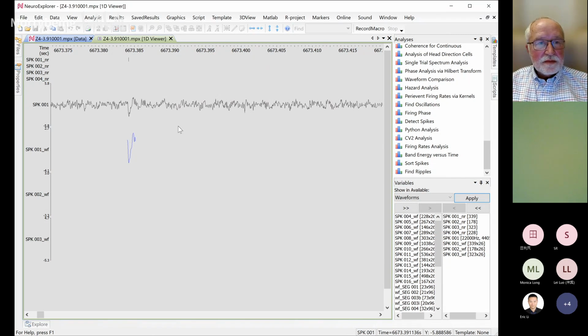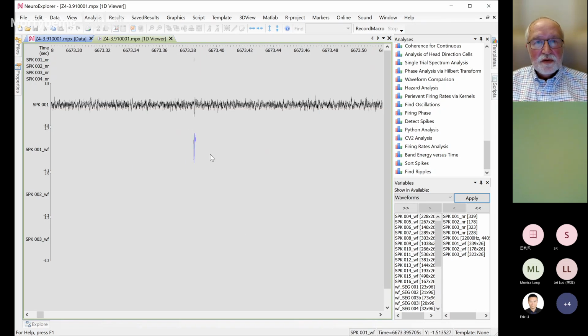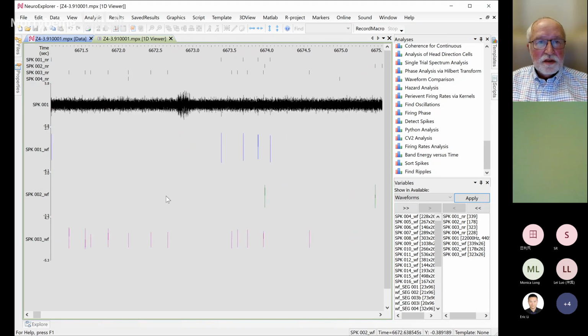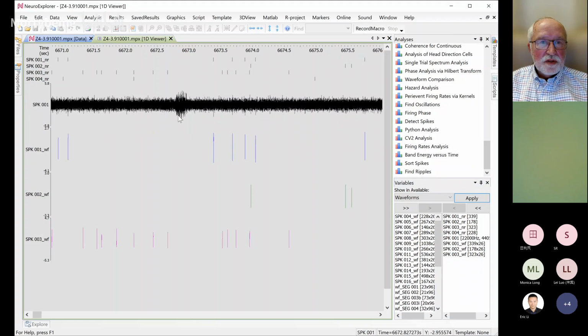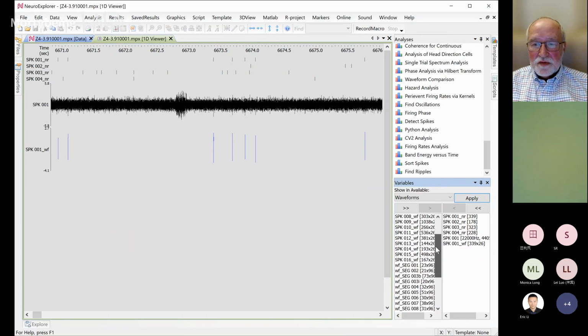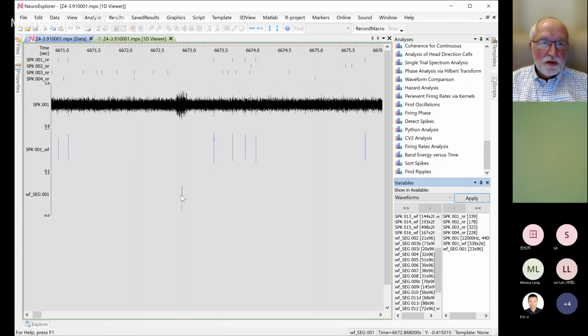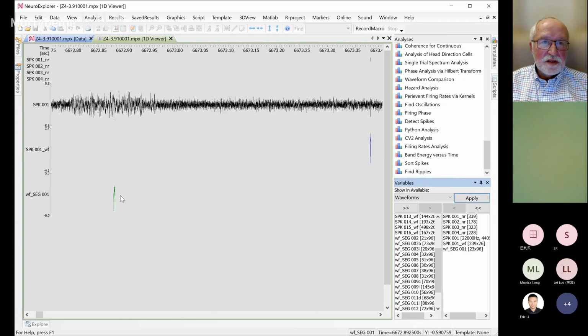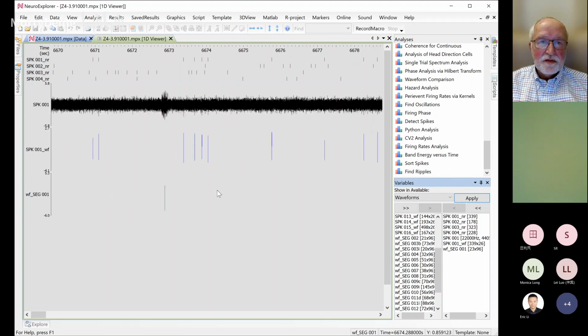If there's noise like breathing noise, can you go back to some place that has the breathing noise? Let's see what it would be in the waveform channel. Let's go to the noise, so breathing. Here. These are the waveforms, the spikes that we detected. So these peaks. If we remove the other two, we can get the waveforms that were originally detected. The waveform that came with the file was here in this artifact area. So now we have spikes outside the artifact areas.